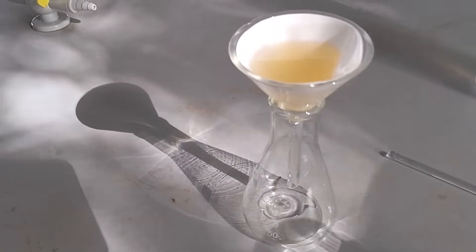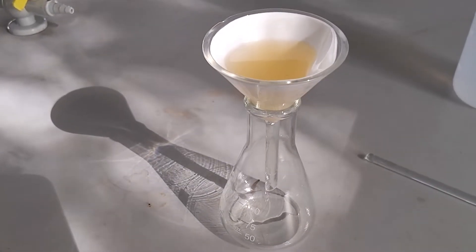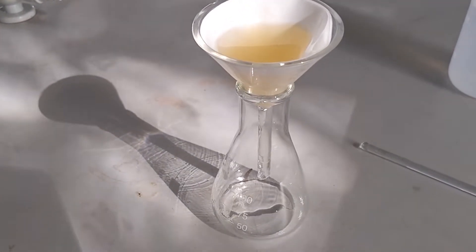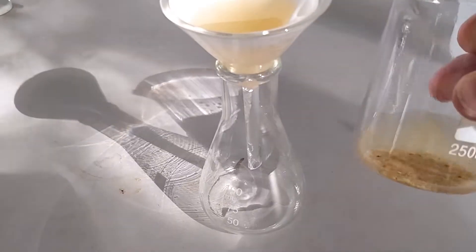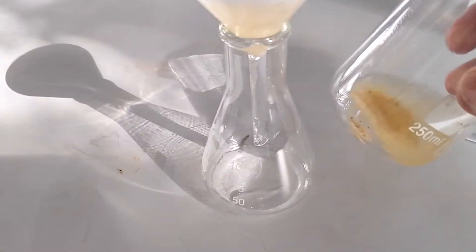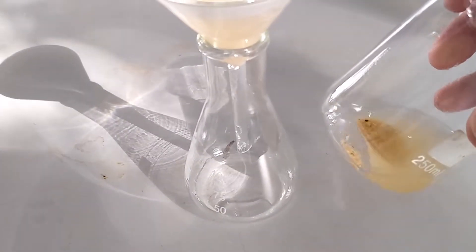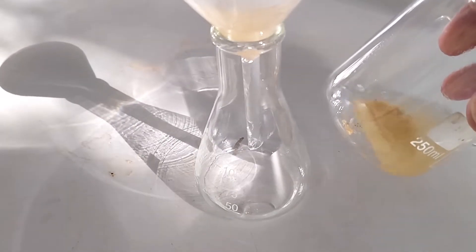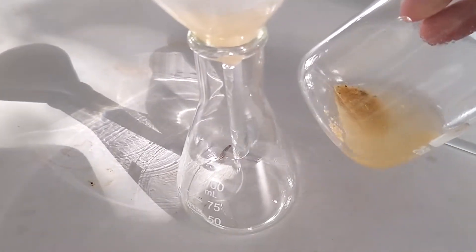What do you see happening? Is the liquid coming through the filter clearer than the mixture in the beaker? What happened there?